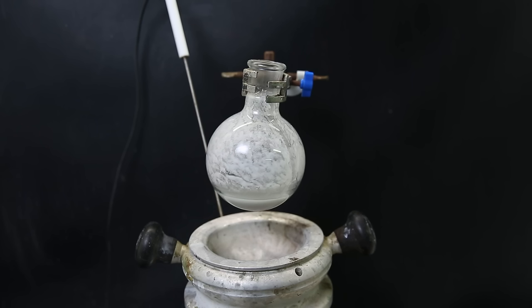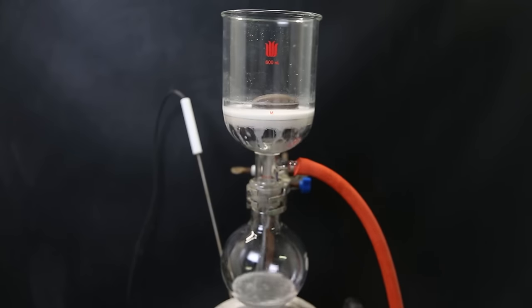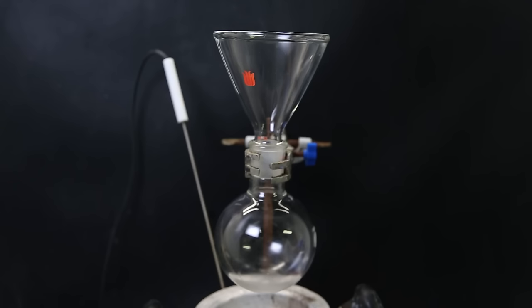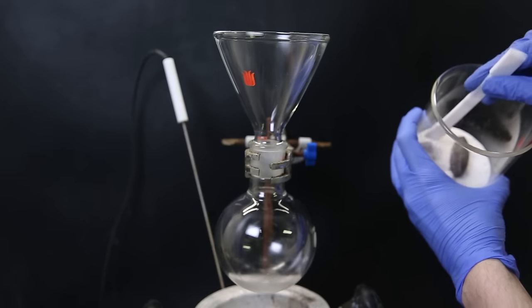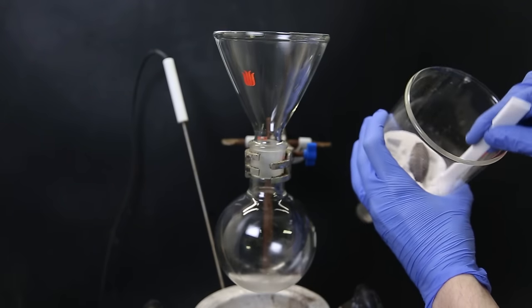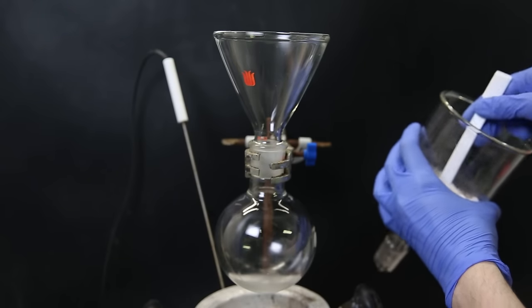There's still some toluene left, but the product isn't really soluble in it. I then filter it all through a glass frit, but it's still a bit grey, so I wash it with some ethyl acetate, which manages to remove the colored impurity. I pulled this workup out of my ass, by the way, since I couldn't find the full procedure. I then gently scrape off the white powder with a teflon spatula, while still a bit wet from ethyl acetate. Do not anger it too much, since this molecule is a potential explosive.